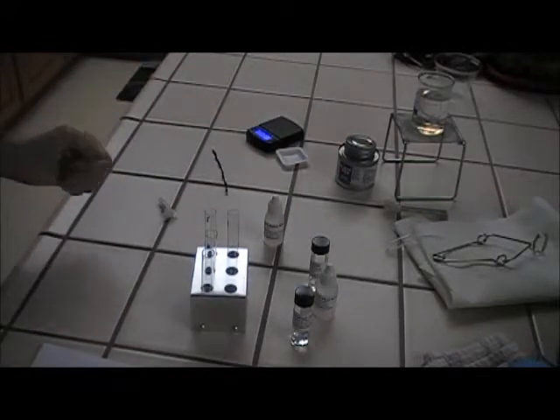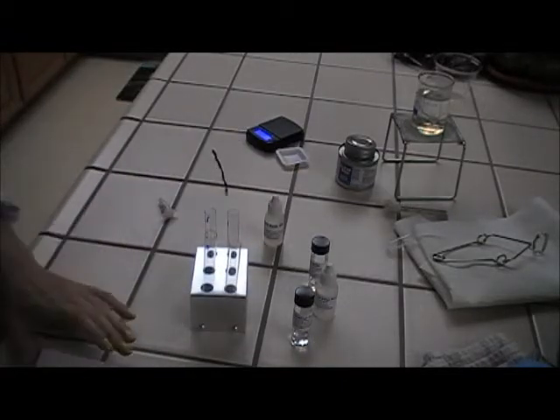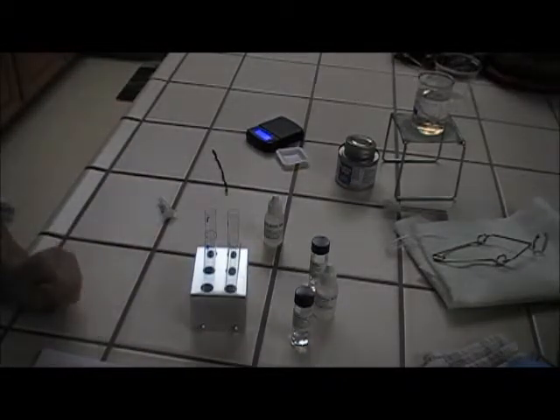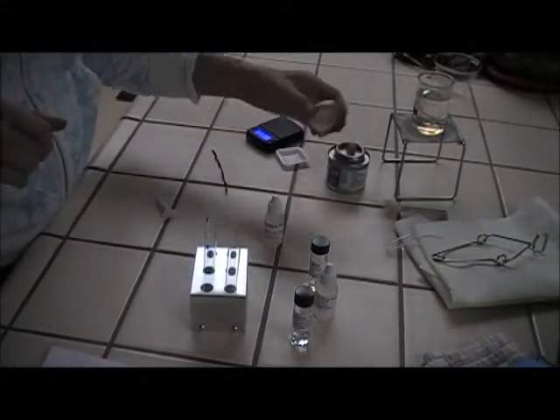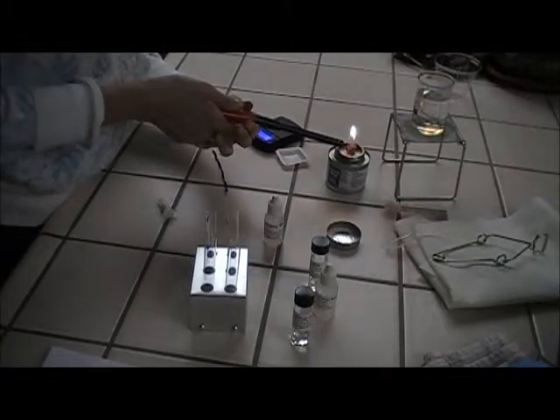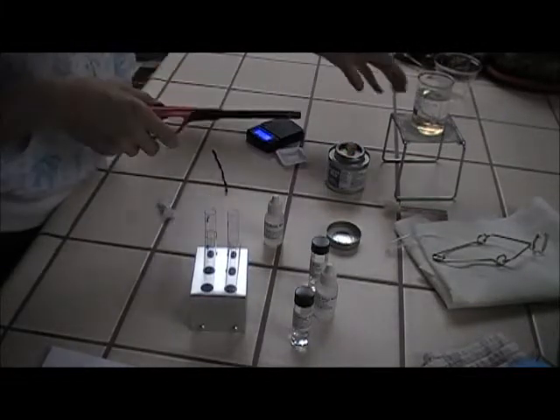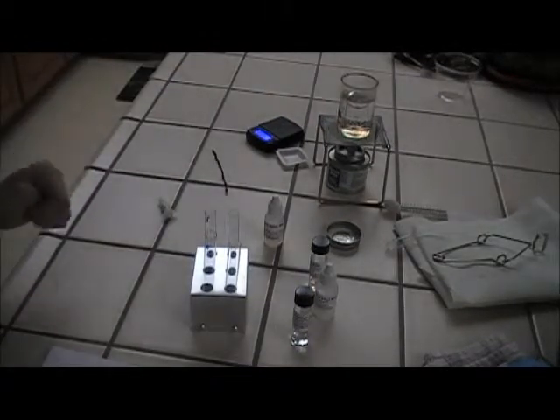All right, and then it says to, I didn't read ahead, add 6 drops of methanol, which I do not have. So 7 is out. All right. Give me 1 second. Oh, it also says to set up the burner stand. We'll get this lit. Get our water going.